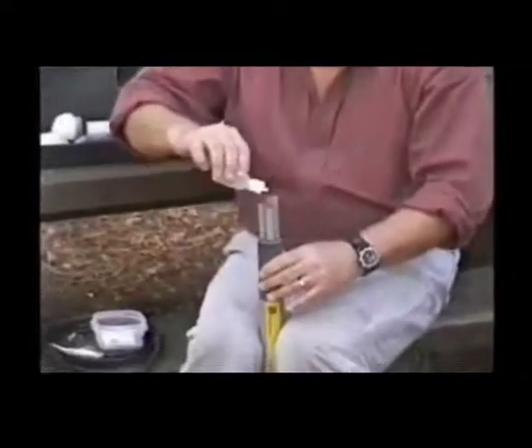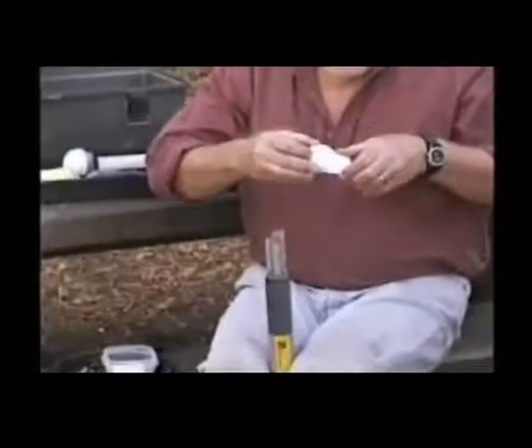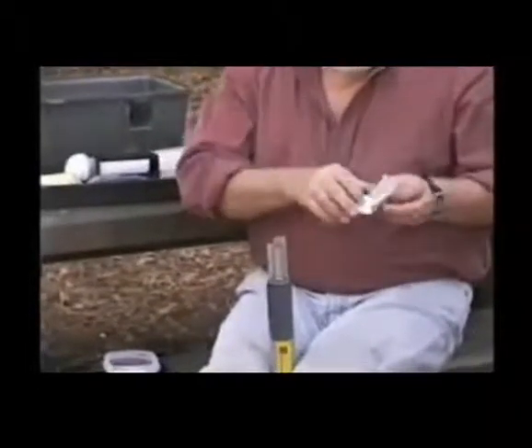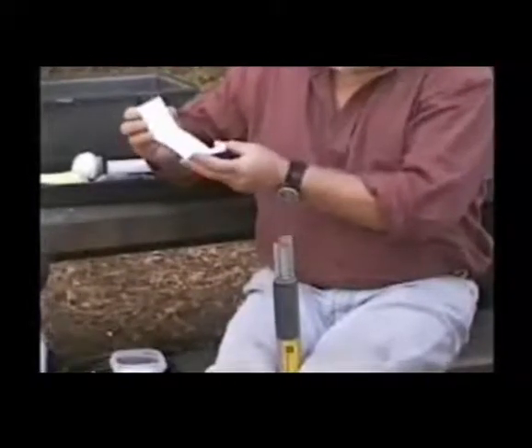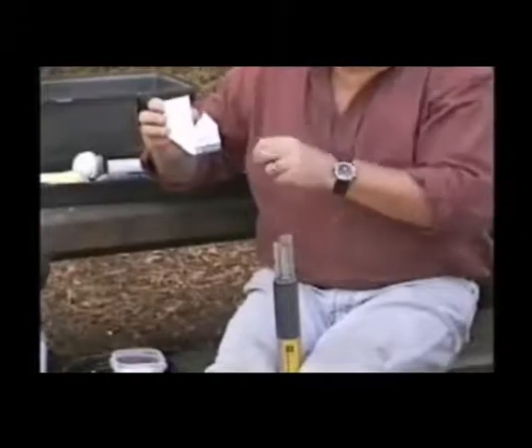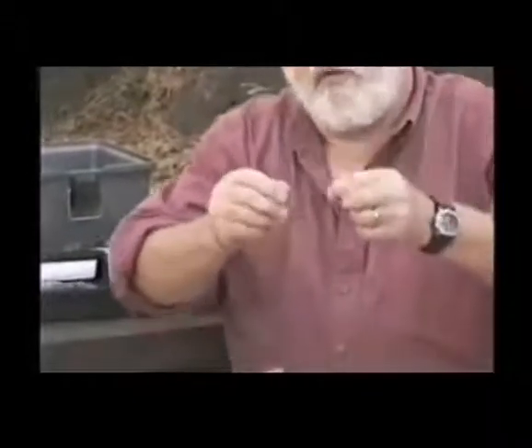Okay. I will then put a little more in there. Put the membrane inside. The membranes come in a little book, kind of like a matchbook. You open them up, and they have an adhesive pad right here, and that adhesive pad will catch one membrane, which you then take carefully in your hands and try not to touch the center part of the membrane. It's very thin but quite tough, and it's made out of Teflon.